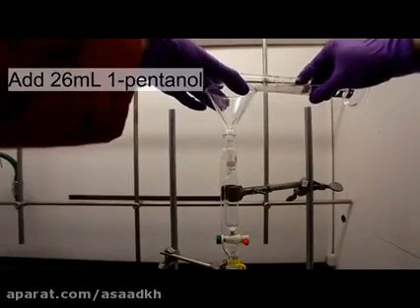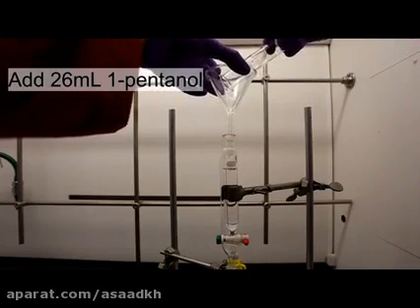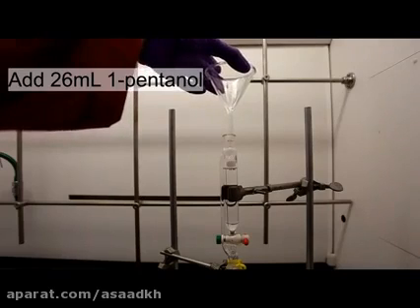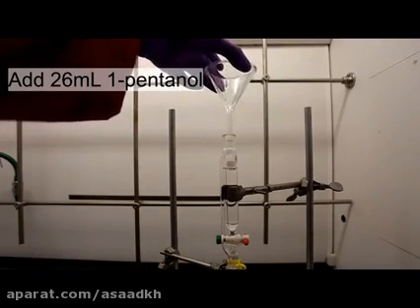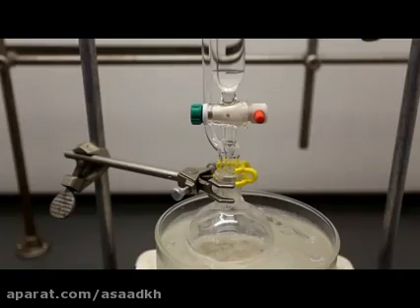26 milliliters of 1-pentanol was added to an addition funnel. I am using a pressure equalized addition funnel because it is much easier, but you can easily use something like a separatory funnel or a Pasteur pipette. With strong stirring, add the 1-pentanol dropwise.